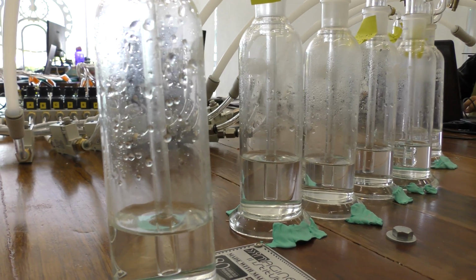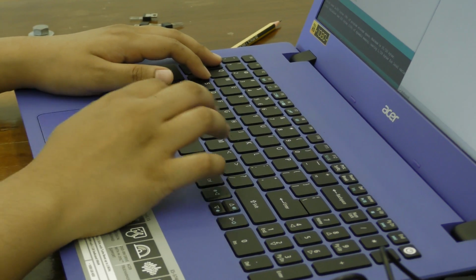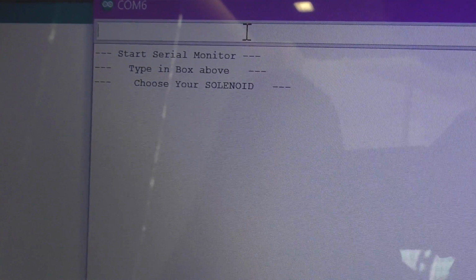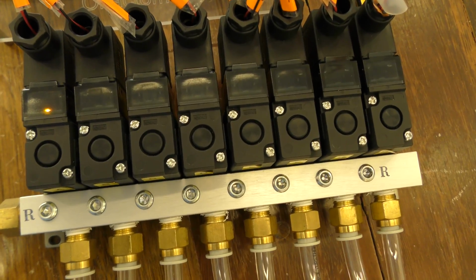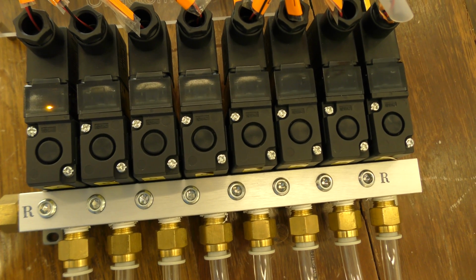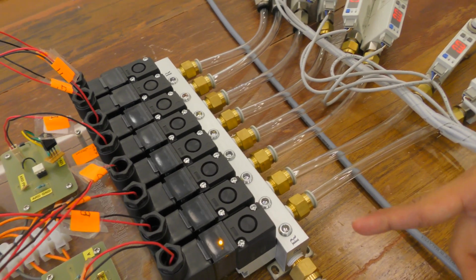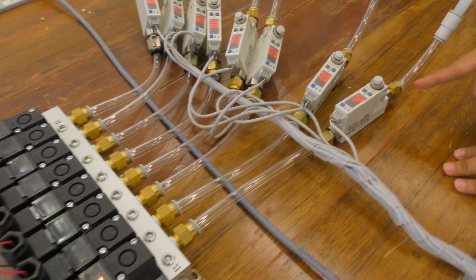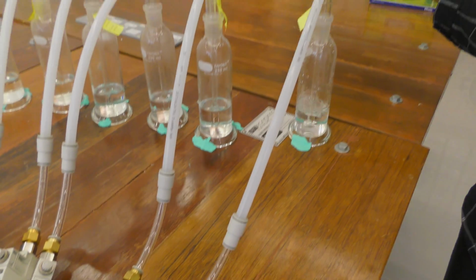As an example, if the control input is the letter A, then the solenoid A will switch on, but the others will switch off. The solenoid A will switch on and air will flow at 4 liters per minute, and it will go to the glass tube and we can smell that here.